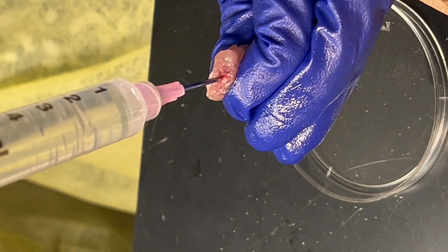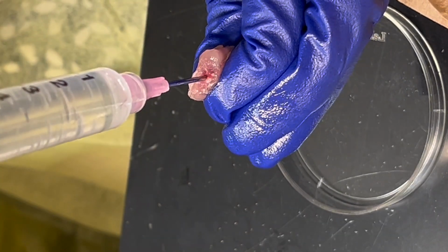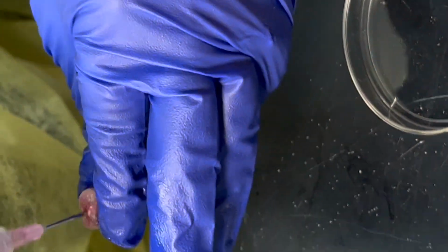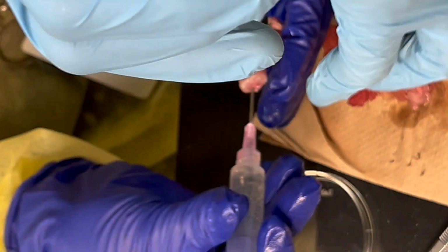I actually get more worried when I see you guys doing it, because it scares me to death that you guys will end up hurting yourselves. But when I do it, I want you to feel here as well. You'll feel the needle now. Oh my god, it's deep. This one is pretty stiff. You would feel how much I got into, right?